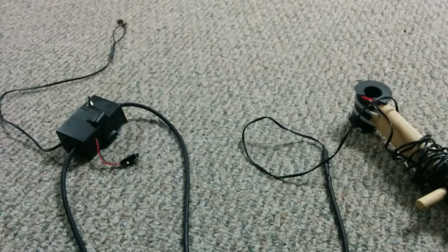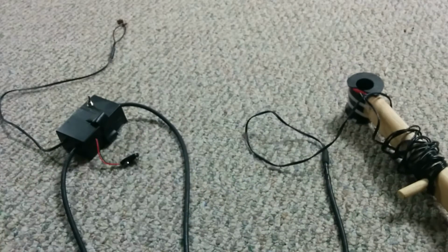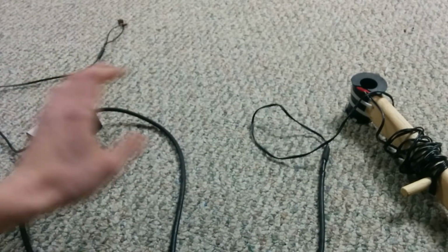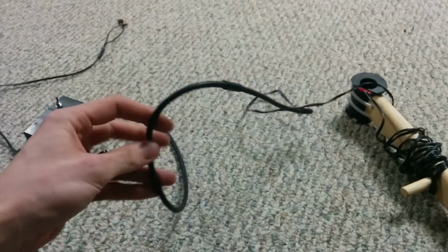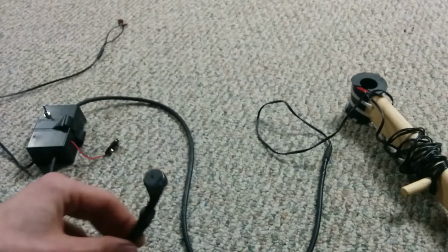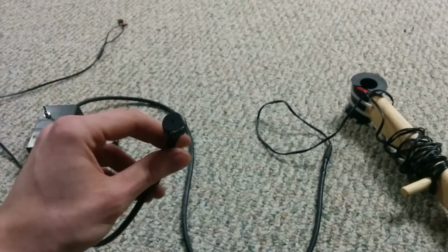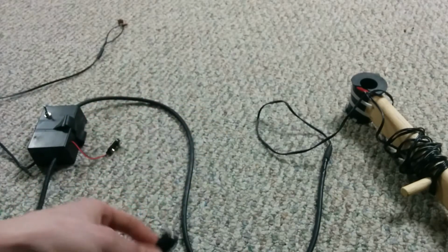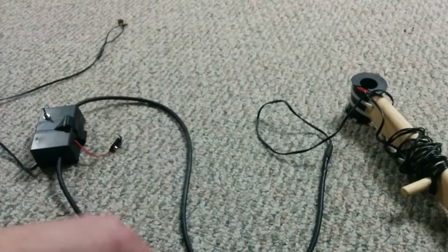But anyways, that goes through this cable, which is haphazardly spooled up on here, and goes into this receiver over here. Now, the 2 feet or so, this is coax, because the output on this thing is a capacitive transducer, also coax. And it has to be shielded all the way around because the electric field can aggress the input. It's the first important aggressor to deal with.